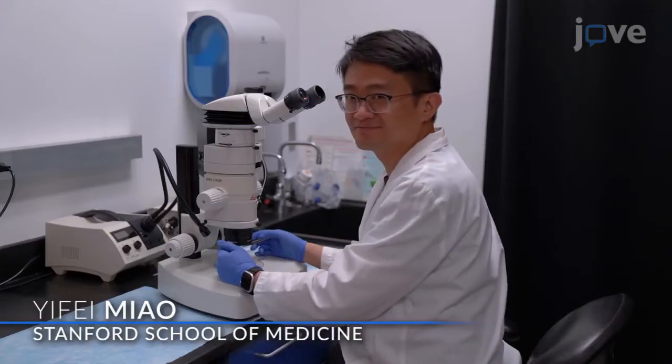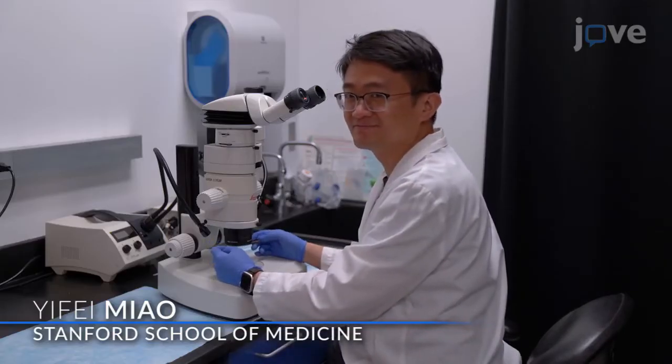The trickiest parts of this method are determining the different heart portions and timing the digestion correctly to avoid cell type contamination. Demonstrating the procedure will be Yifei Miao, a research scientist from my lab.